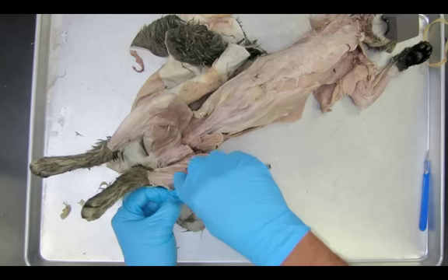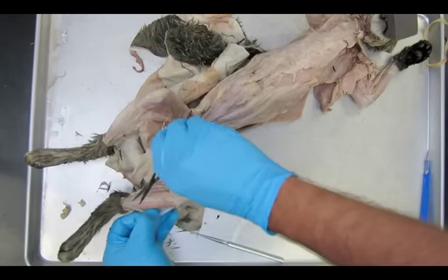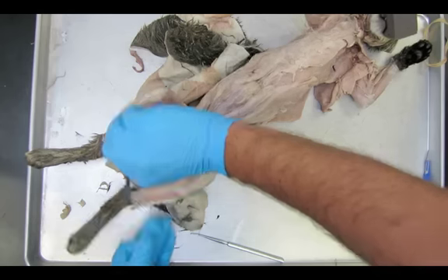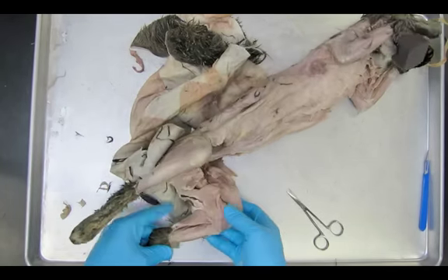There we go — you can actually now see the muscle's been exposed. It's very important that you do this for dissection 15, so make sure you've removed all the fascia off the surface. We'll have a good view of this in the future.